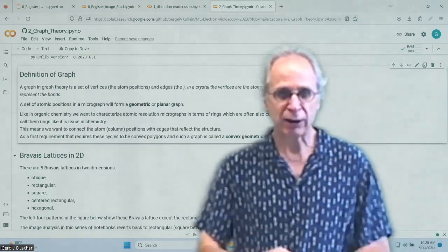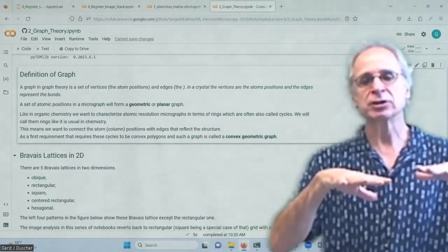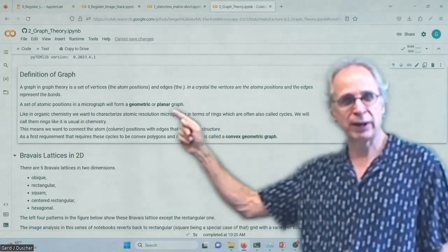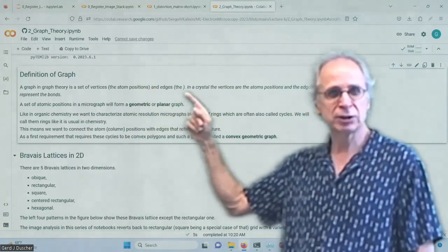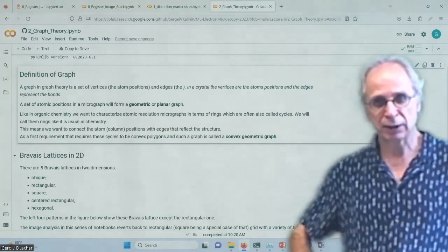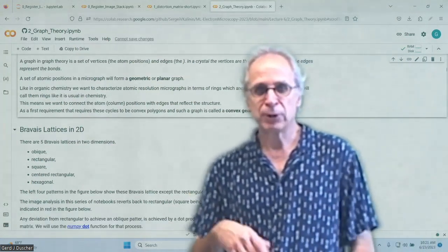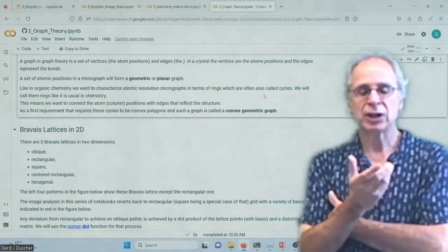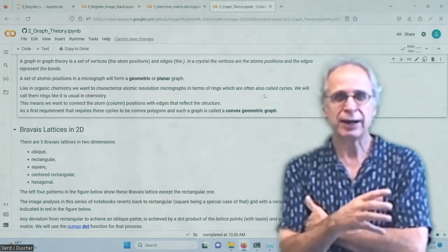Okay, and so now we are looking for graphs: the atomic positions or projections. So we have a planar graph, which is good to know. Geometric or planar graph is what we see. The vertices or nodes, right, are the atom positions. Generally, the edges are either, as we saw, the unit cells or the bonds. And if we look into organic chemistry, what we want to see most of the time is rings. So we want to look at these atomic positions as a ring graph.